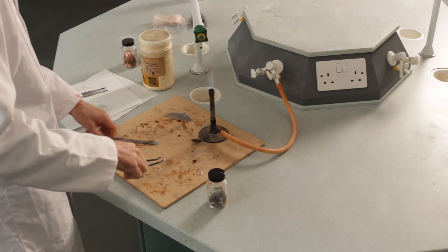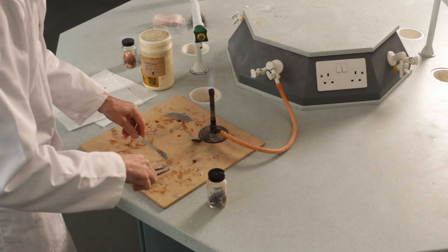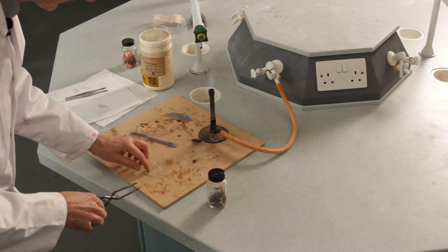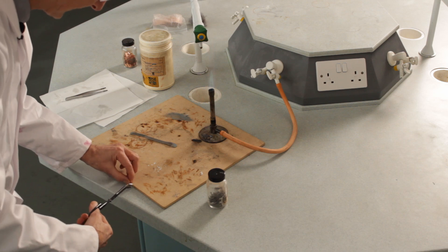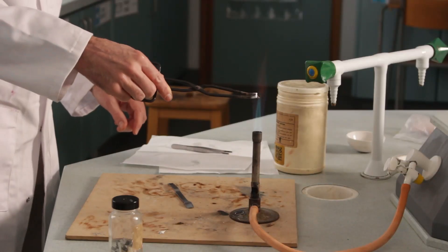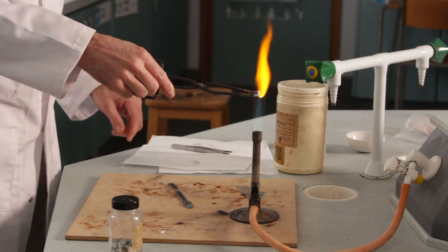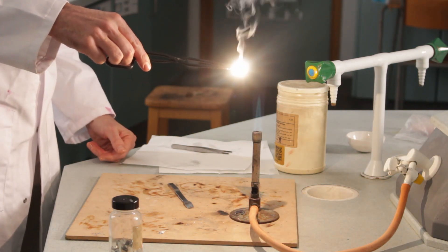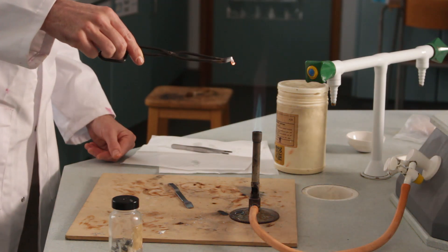It couldn't get any air, so I'm going to pick that back up and see if I can get that back in there and see if we can get that last little bit to light. It didn't burn because I was holding the tongs on it—it wasn't getting any air, therefore wasn't getting oxygen, so it couldn't react.